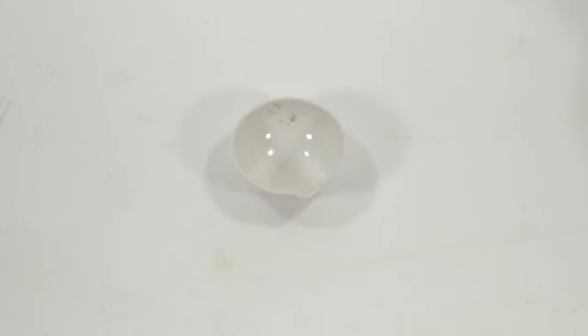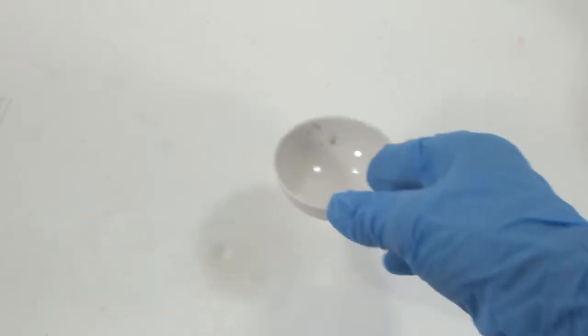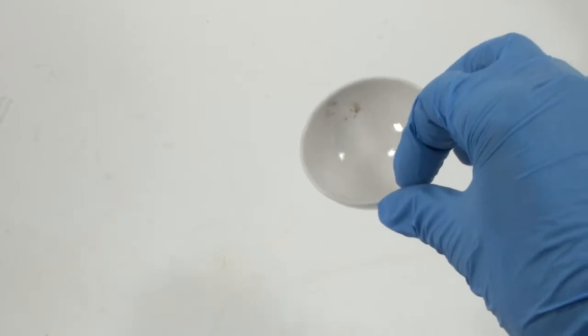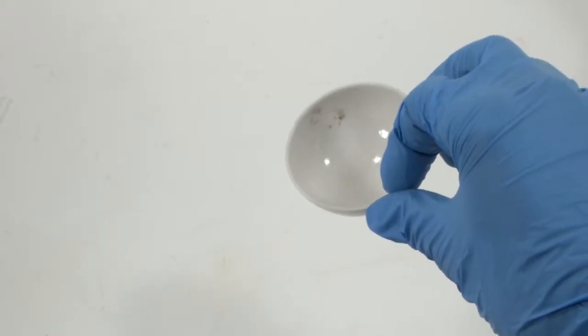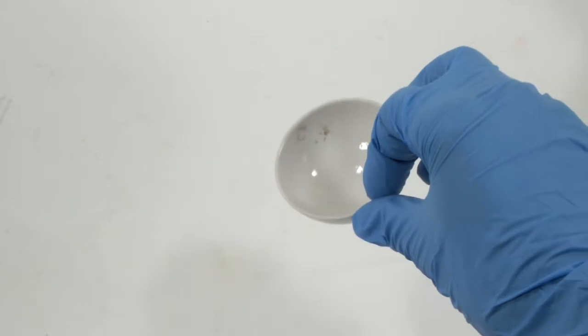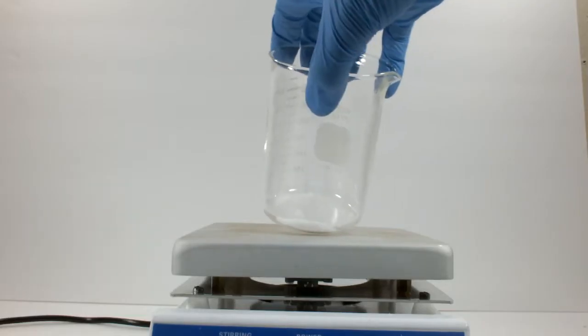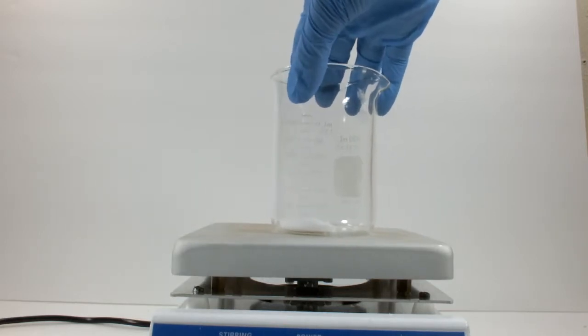If you find yourself with some badly stained labware, be it glass, porcelain, or stainless steel, you might need an aggressive cleaner. In this video, we'll make a cleaner that excels at removing carbonaceous residues, especially from porcelain. Mixing up a batch is really simple.